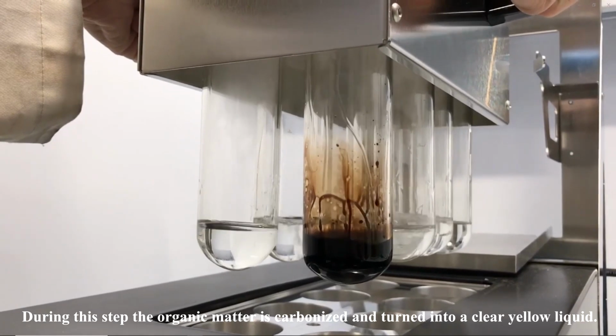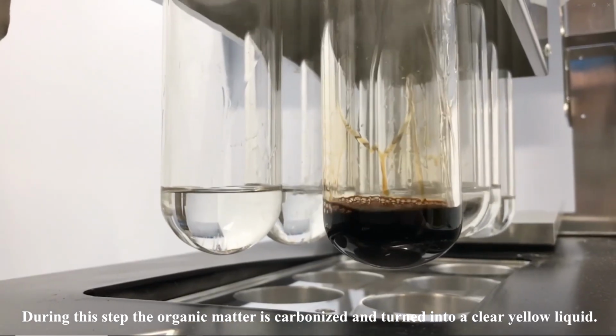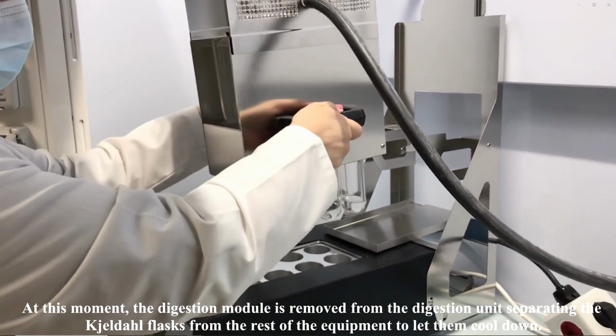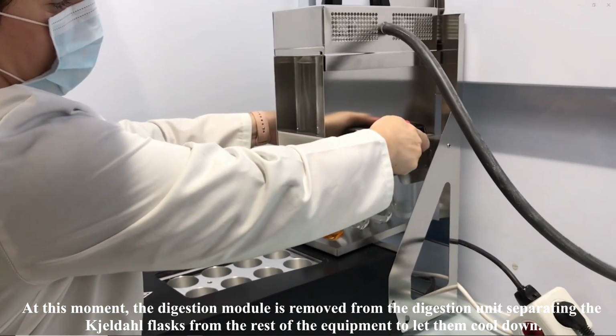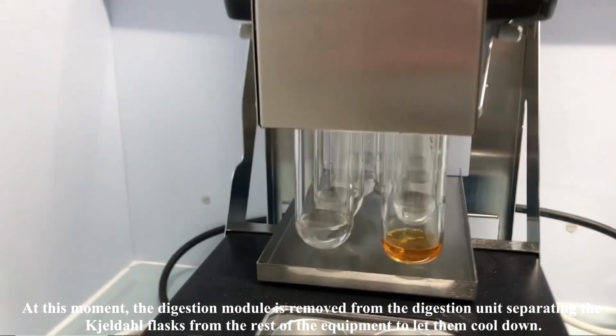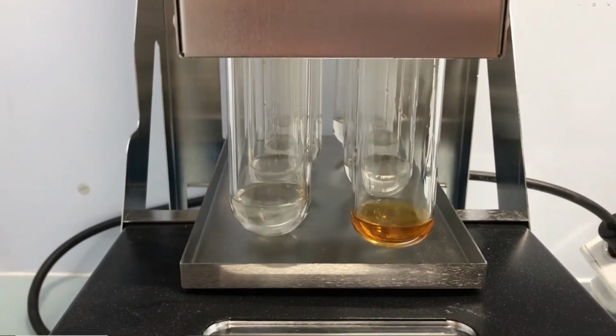During this step, the organic matter is carbonized and turned into a clear yellow liquid. At this moment, the digestion module is removed from the digestion unit, separating the Kjeldahl flasks from the rest of the equipment to let them cool down.